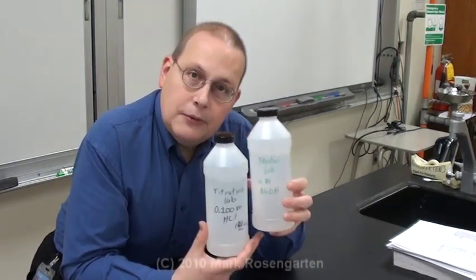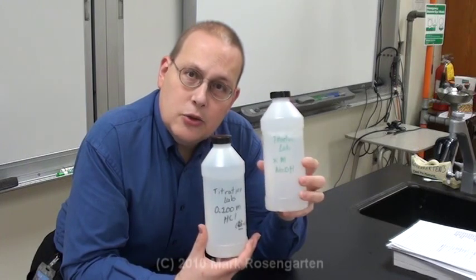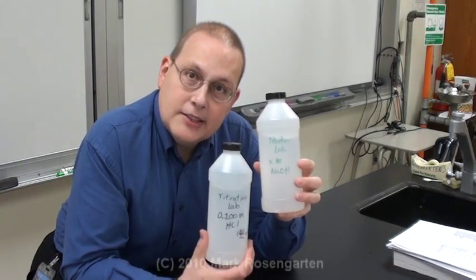So what we're going to do is neutralize the acid and the base. We're going to figure out how much base it takes to neutralize a certain volume of the acid. We're going to use the titration equation. Number of H is MAVA equals number of OH is MBVB.